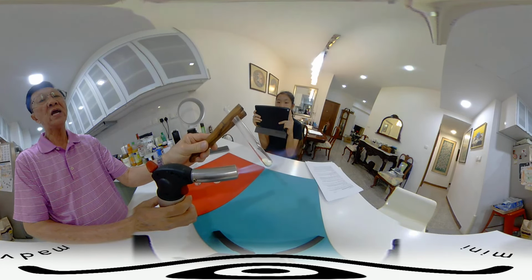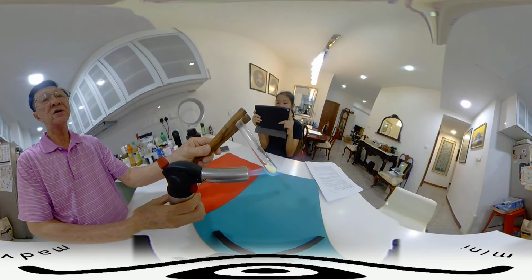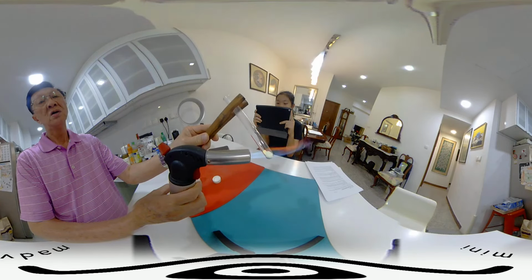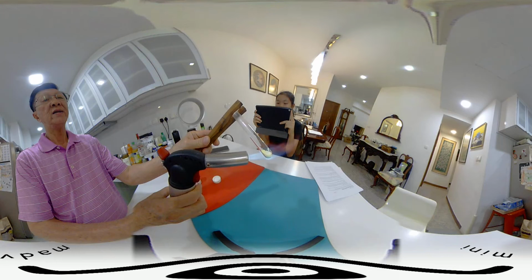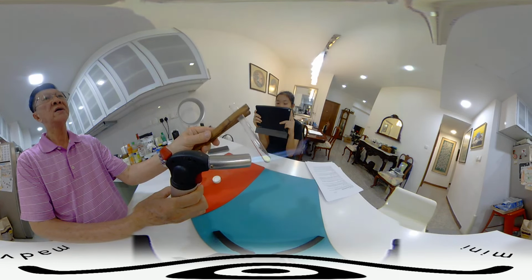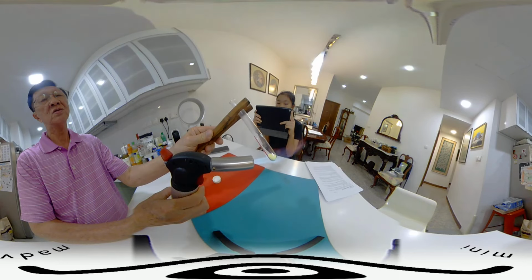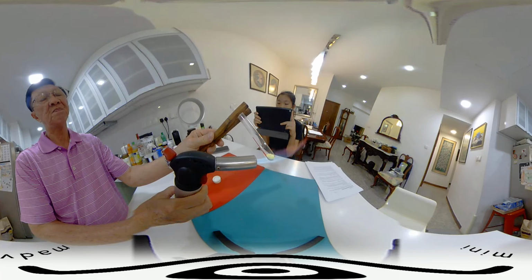I'm heating it and it changed to yellow. It changed to yellow, right? Can you see? It changes to yellow. So when it changes to yellow, you may think that there is a reaction. Can you see now it's yellow? Right? It's yellow. And let's make it more yellow. The hotter it is, the more yellow it will become.